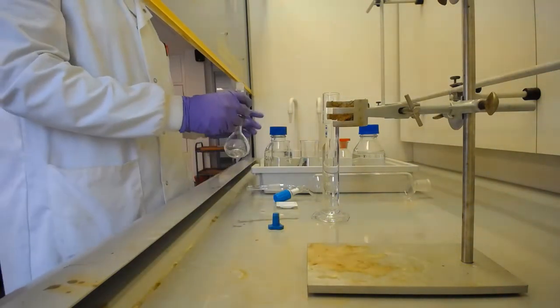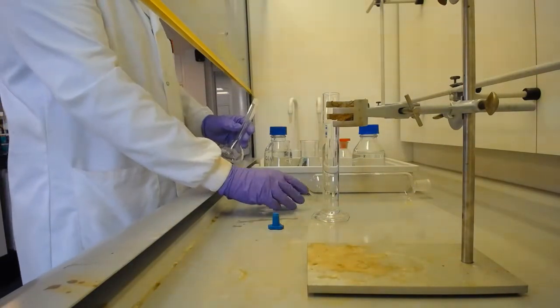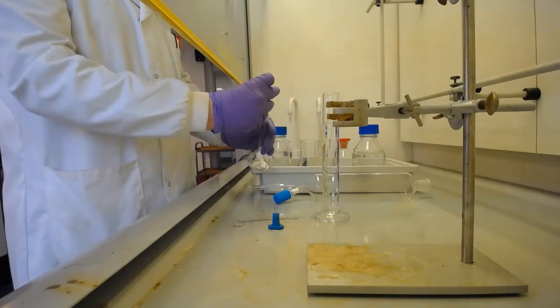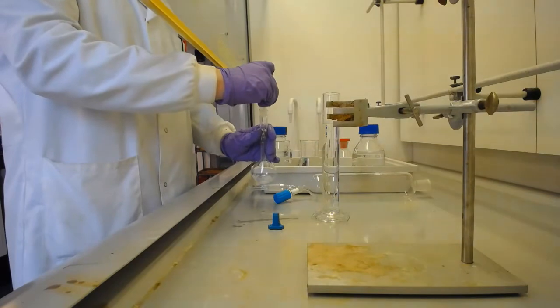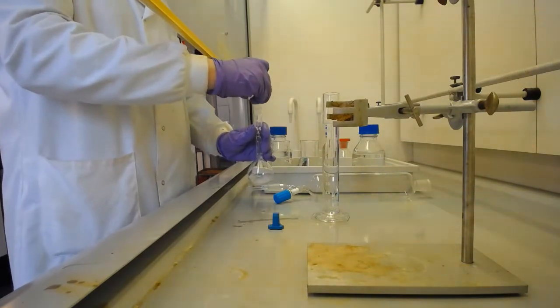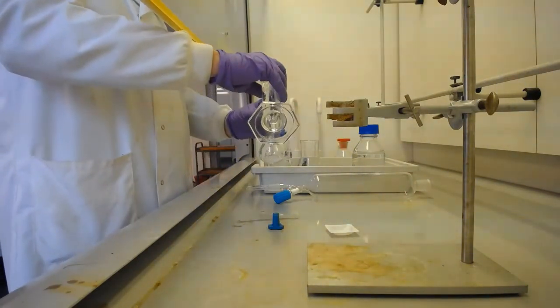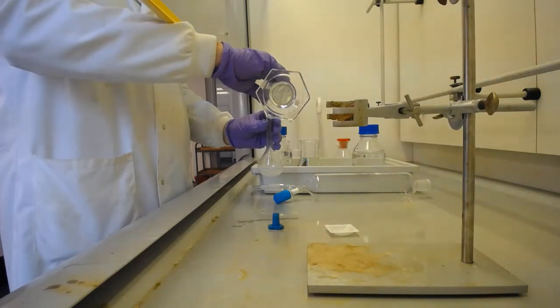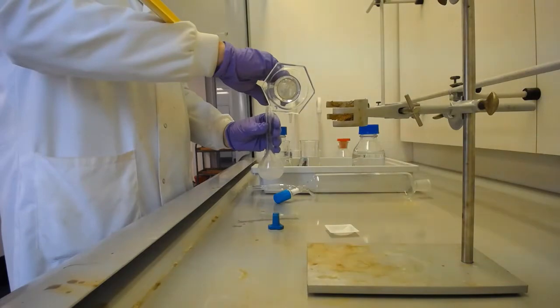Ideally, you might want to do this in a round bottom flask. I just happen to have the volumetric flask to hand here. And then I will move over to the sonicator and talk briefly about how to safely use that. Now we need to use the sonicator because trimethoprim, whilst it is soluble in dichloromethane, it's not a fast process. And so we're going to do that to speed the process up.